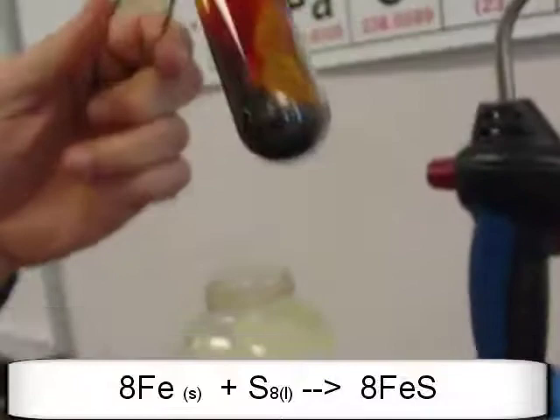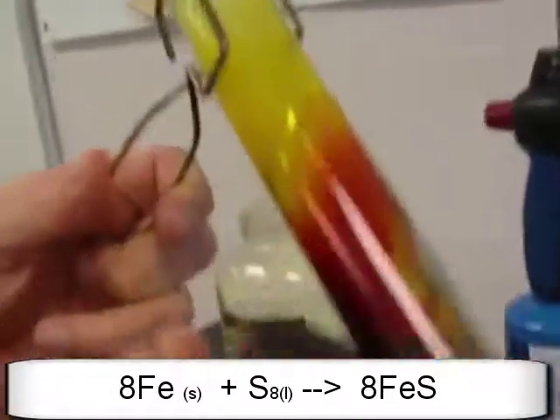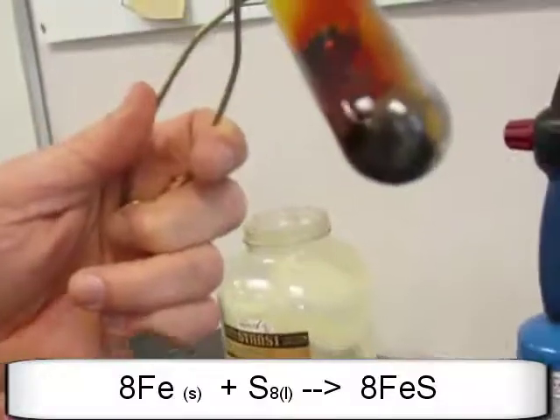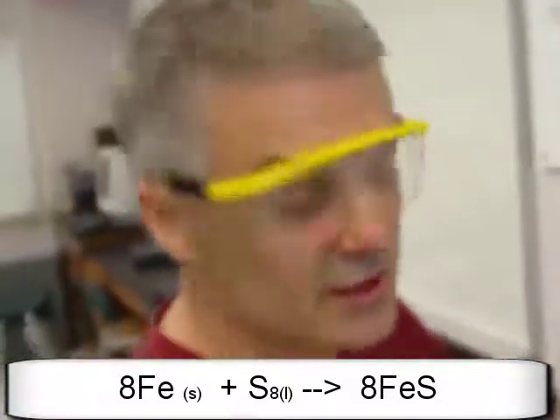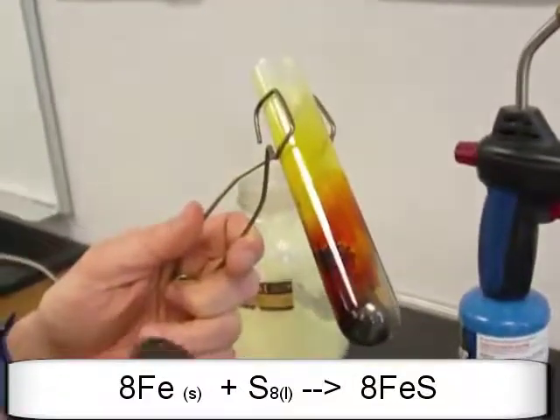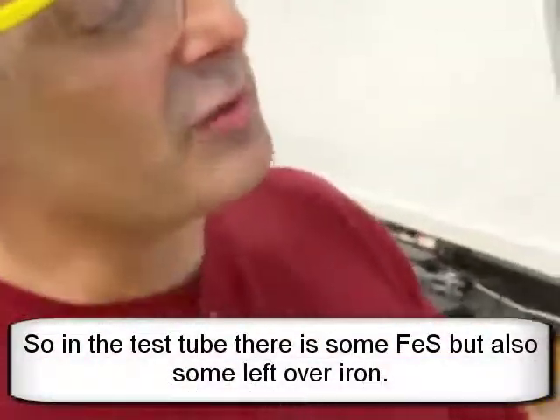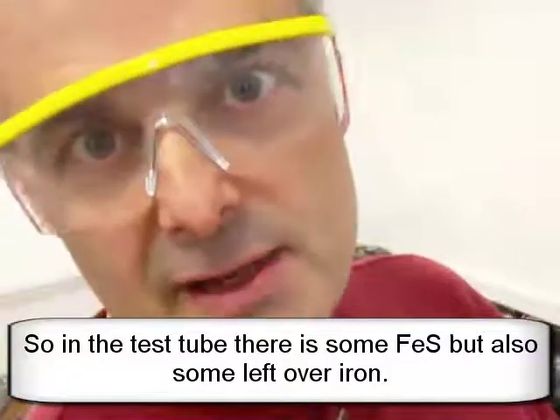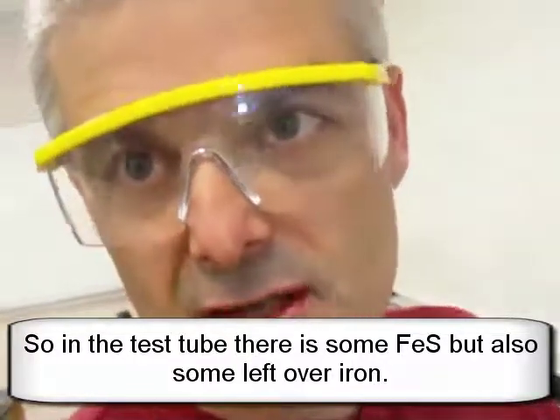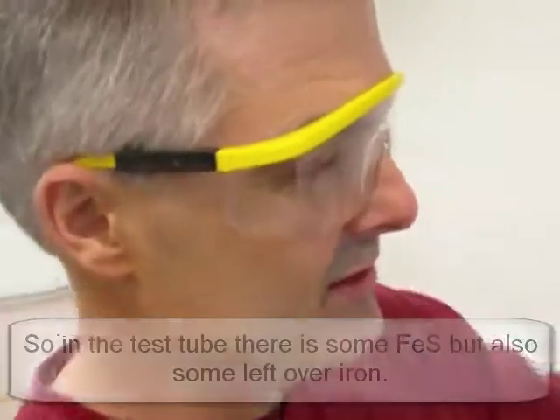Here's the interesting thing: if I take the magnet now that the iron has reacted, it is no longer going to be attracted to the magnet. As you can see there's some that's still attracted, probably because I didn't put enough sulfur in the reaction. But if it had truly fully reacted, it would not be attracted to the magnet at all, because you've produced iron sulfide as opposed to just iron and sulfur. It smells like I'm at Yellowstone — that's because sulfur stinks.